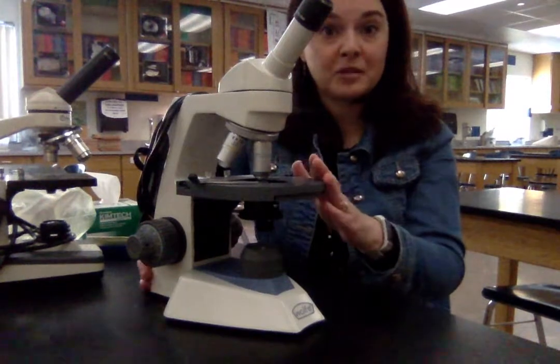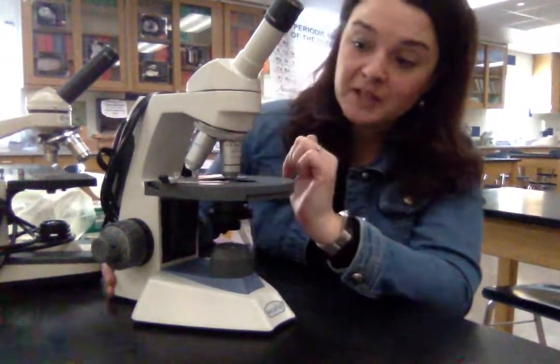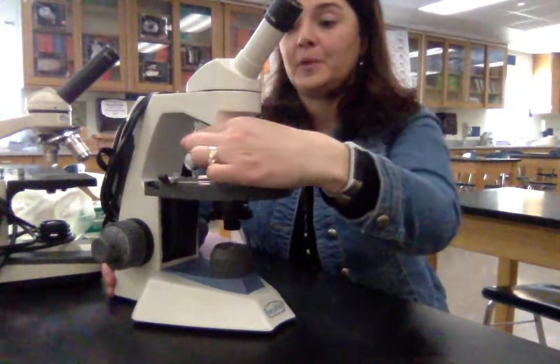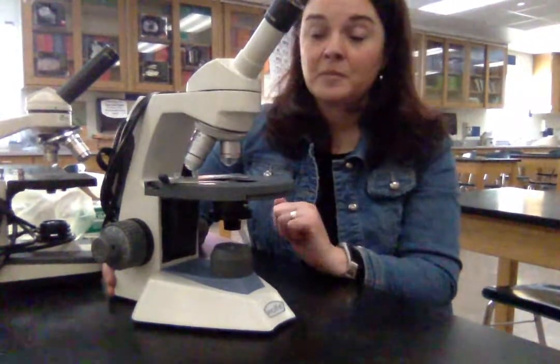These newer microscopes have a lot more easy-to-use functions as far as putting the slide on the stage and finding things. This teacher version has an oil immersion objective — a special objective that students won't be using, but it does magnify a thousand times, which makes it very handy to see bacteria. However, you need a special kind of oil to put on the slide to view. The low-power objective is where we always start — before we even put a slide on the stage, we want to make sure we're on low power.